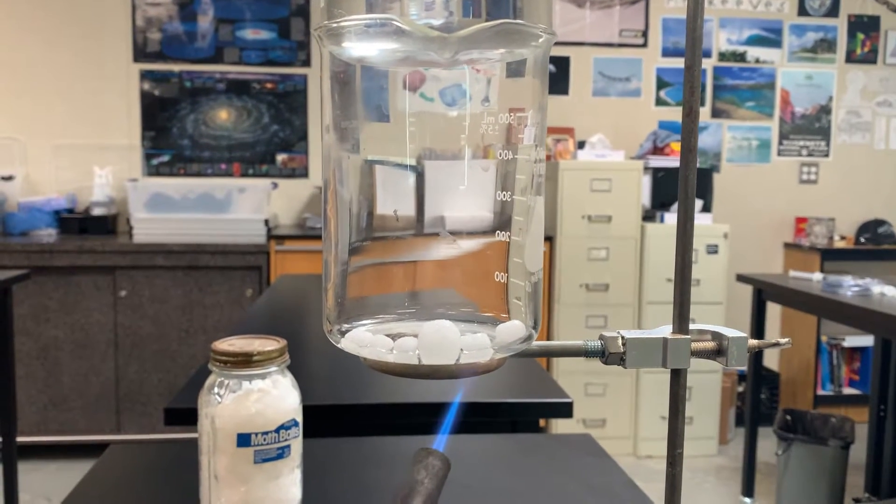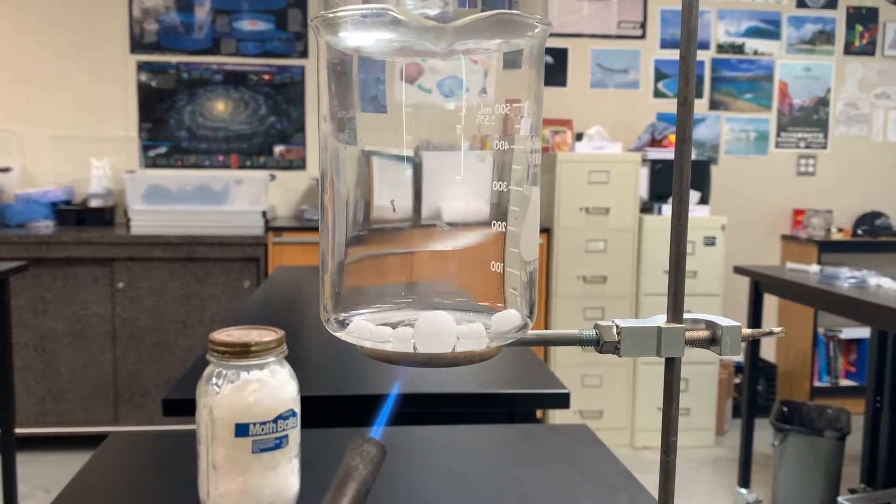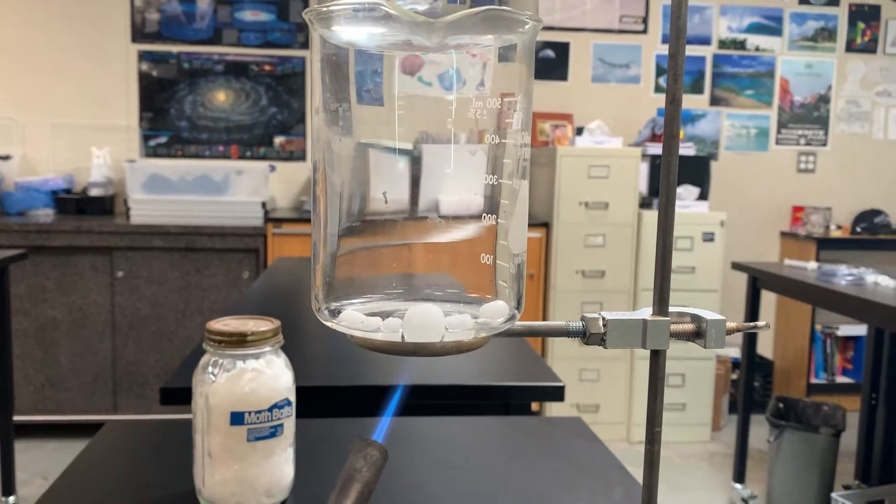And it looks like a clear, thick liquid. It's thicker than water, but it kind of looks like water.